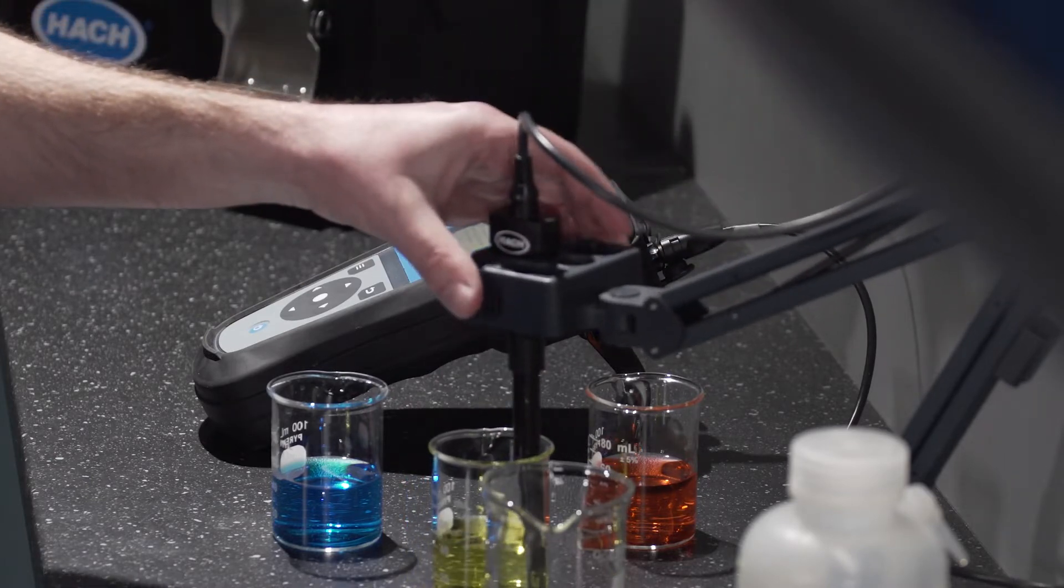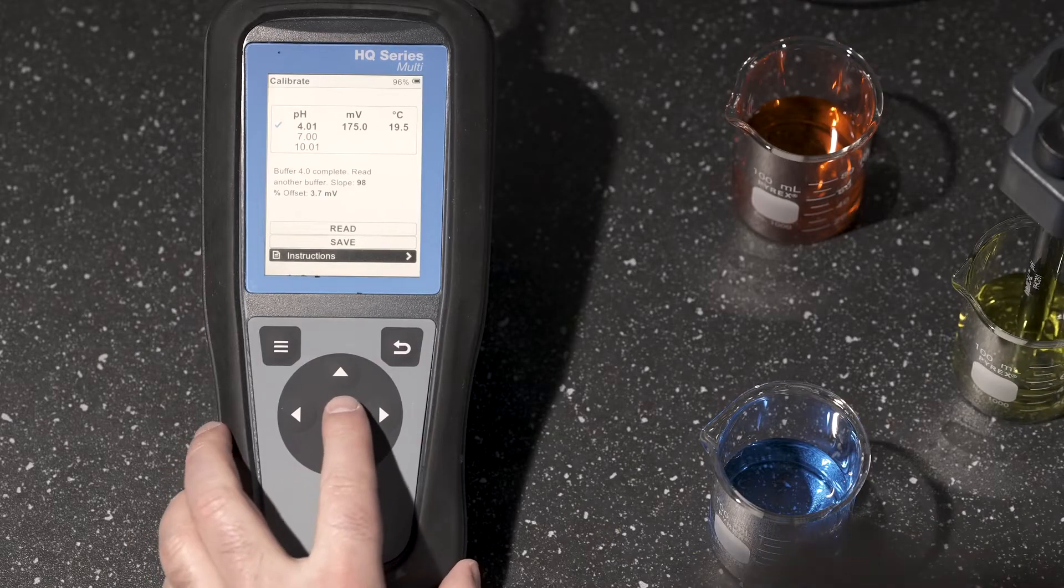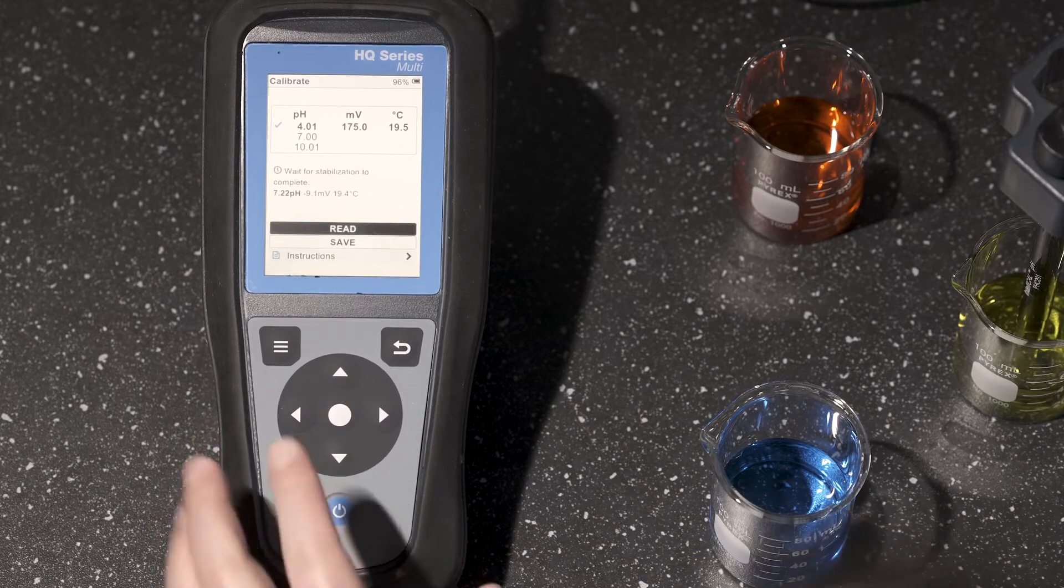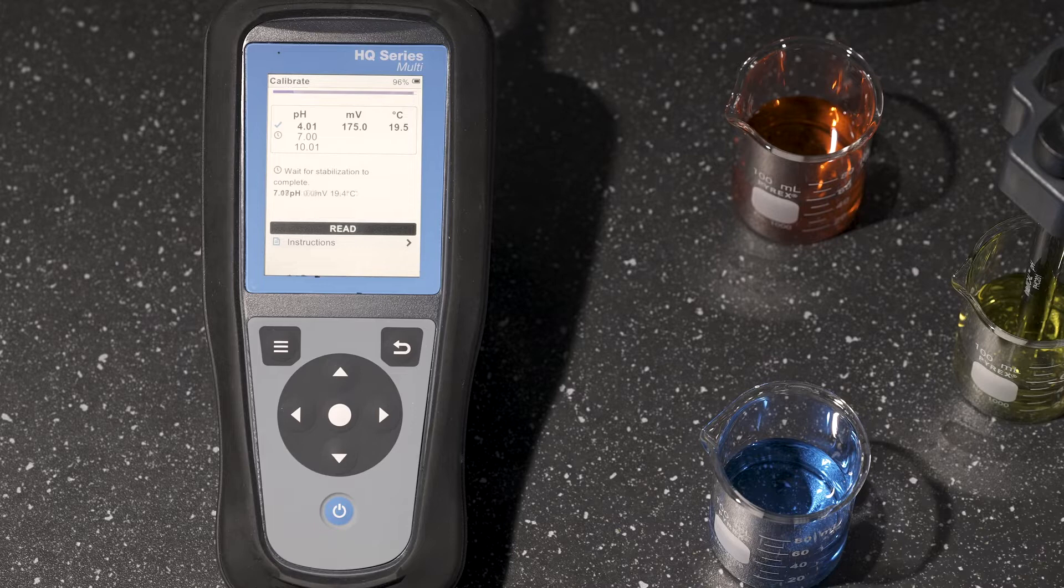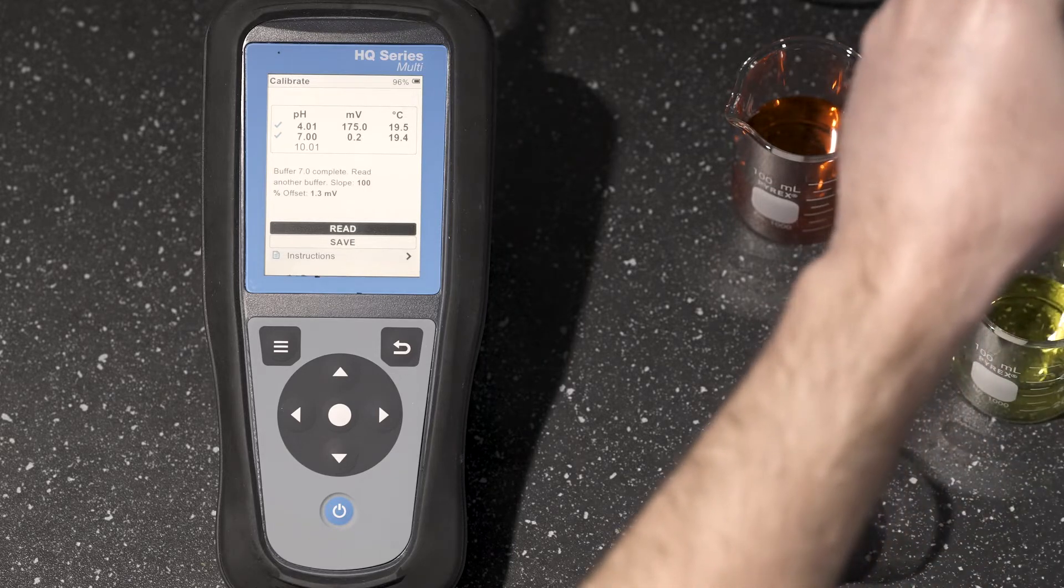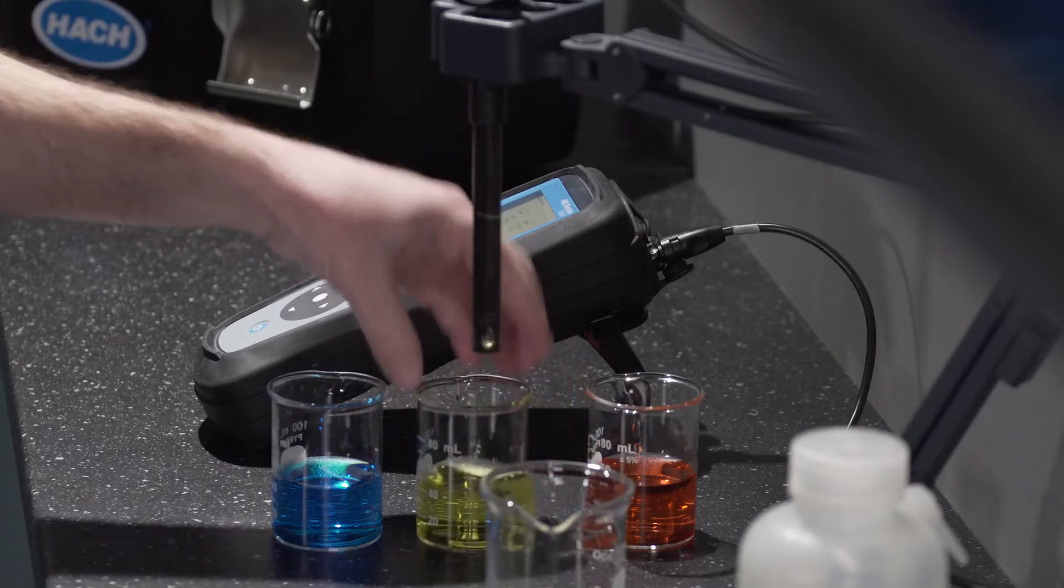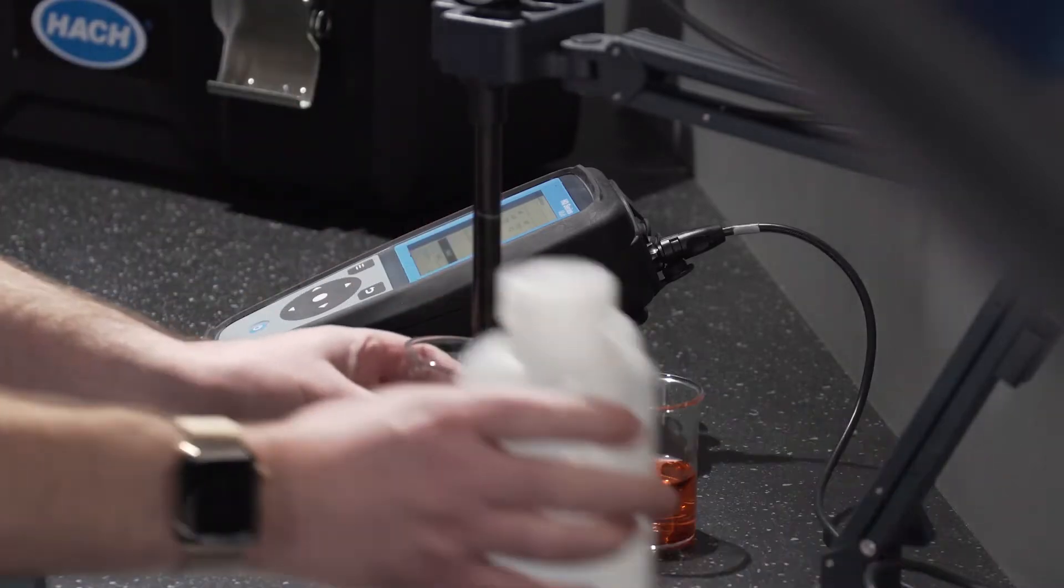Go ahead and get into my second buffer and read. Buffer 7 is complete and I will go ahead and do that third point.